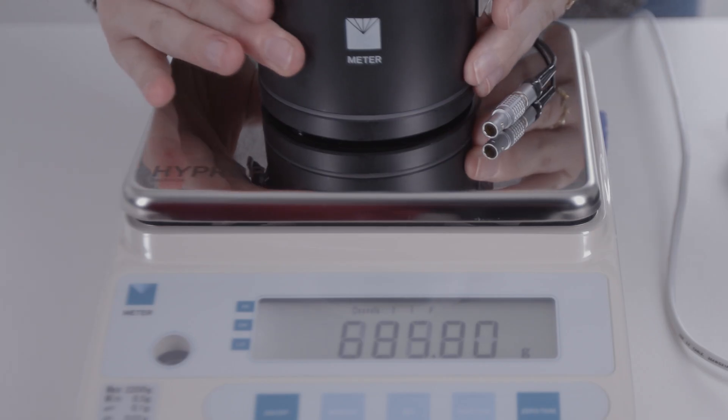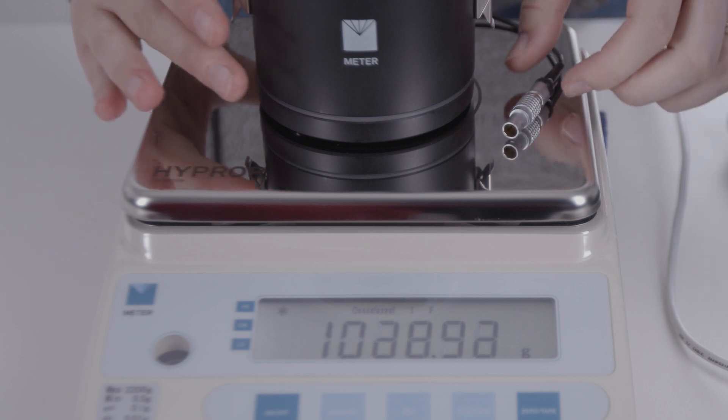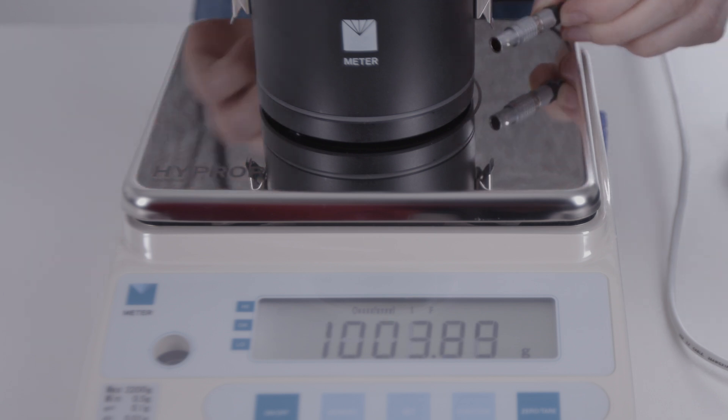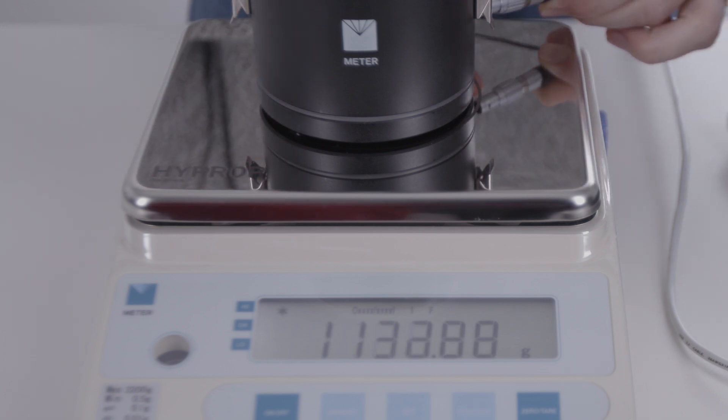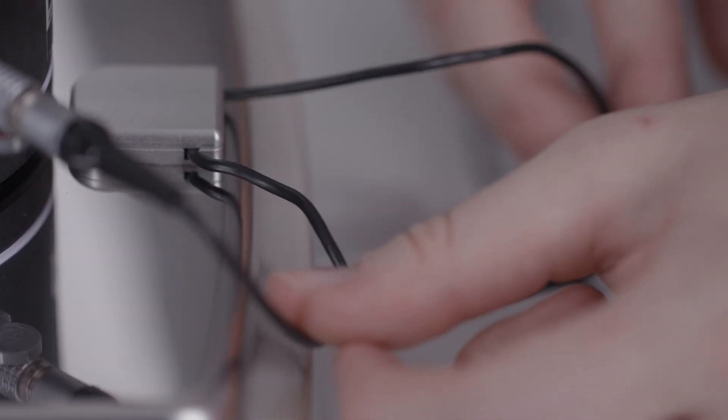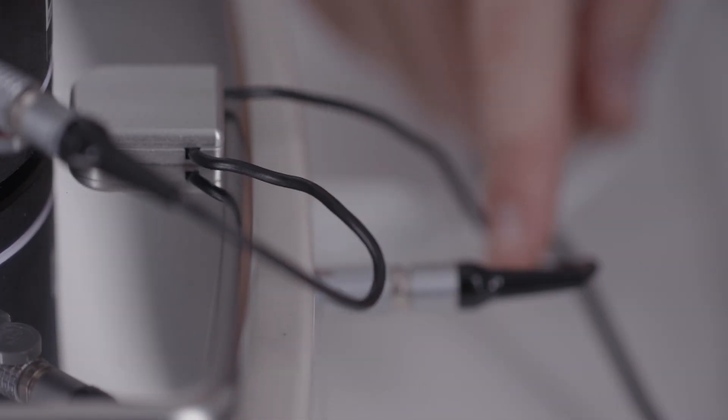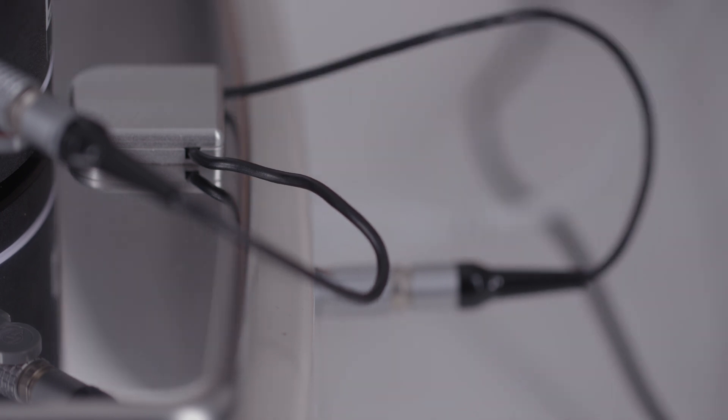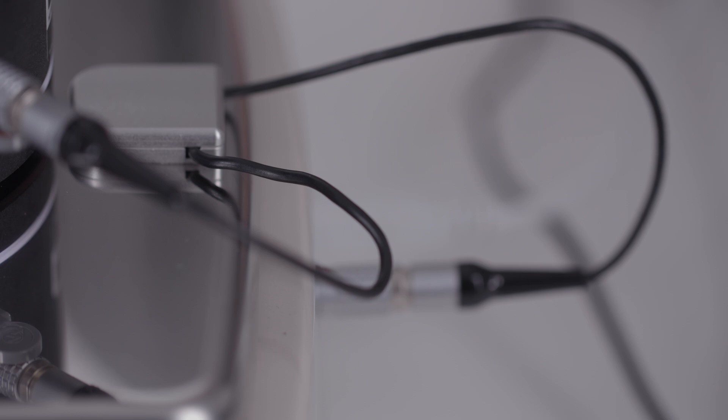Put the sensor unit on the balance. Be sure to place it in the marked circle. Connect the sensor unit. To prevent noisy measurements, make sure both ends of the sensor unit cable don't touch each other. The cable from the balance to the magnetic clamp must lie freely as a loop without touching anything.